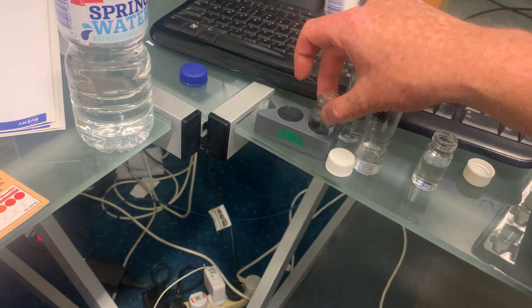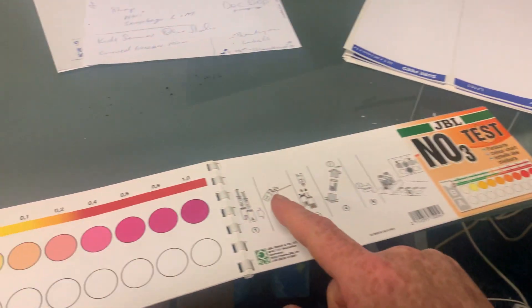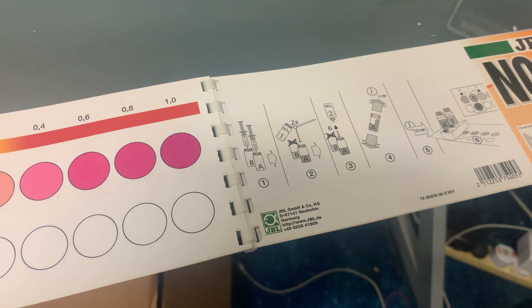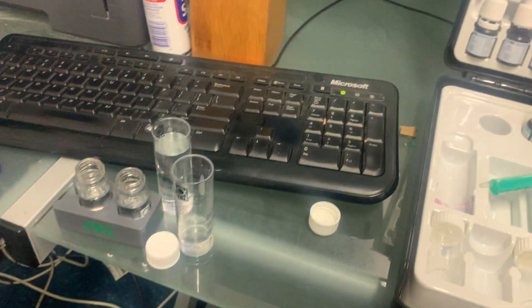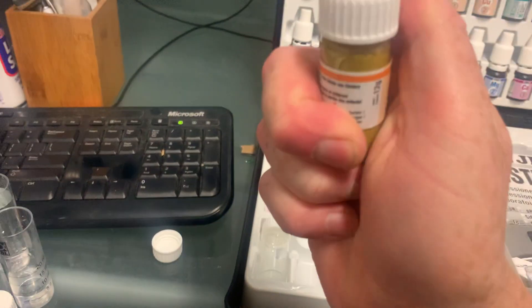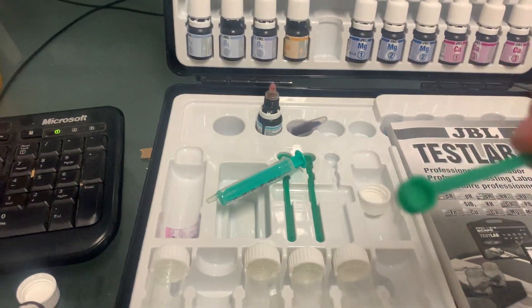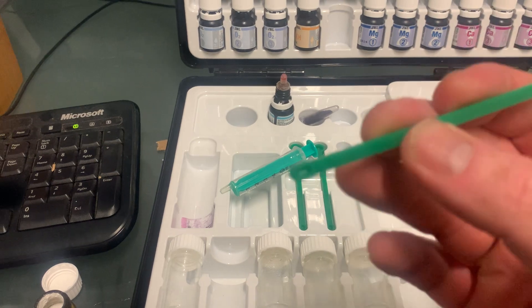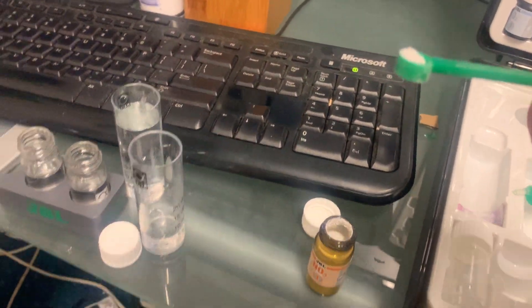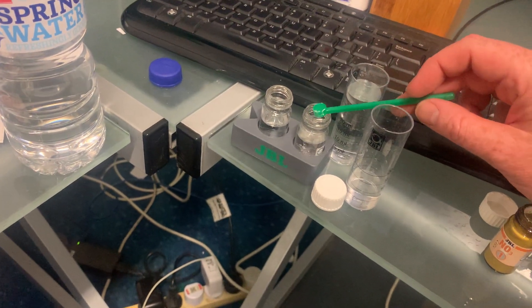We put one aside as the control. Then I'm going to get the nitrate powder and put in two scoops — it's the fat end of the scoop. So I scoop that, give a little tap to get a nice flat measure of that, and tip it in. Then I get the next scoop and make some attempt to make it flat by tapping it a few times. Try not to get this wet because then it's a pain to clean.